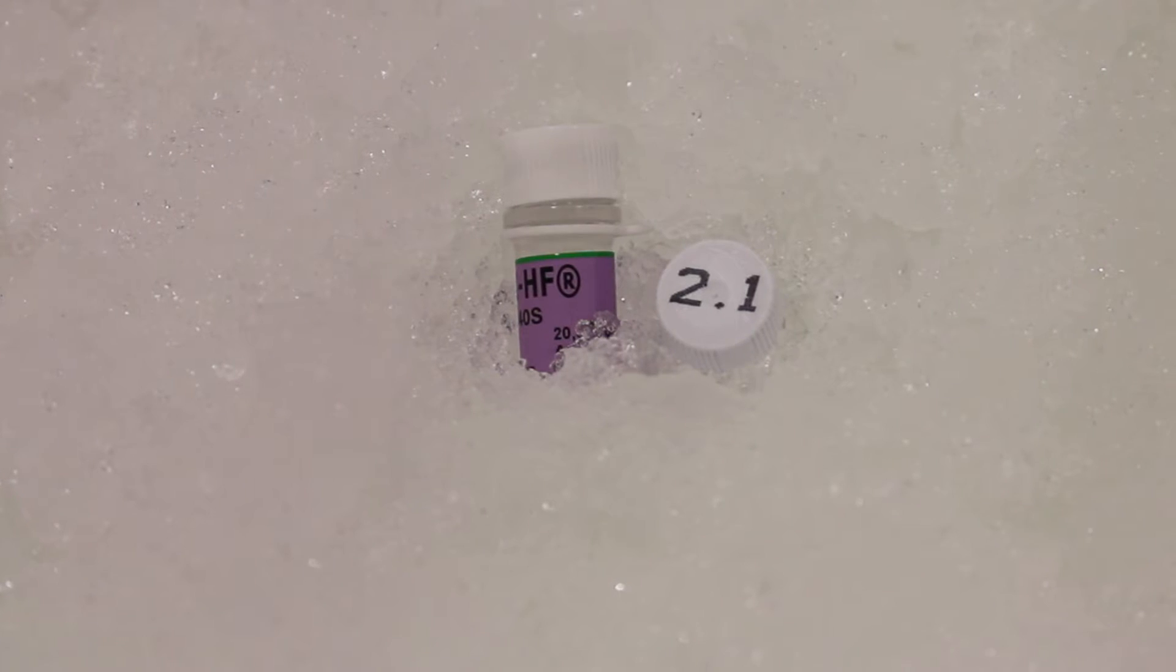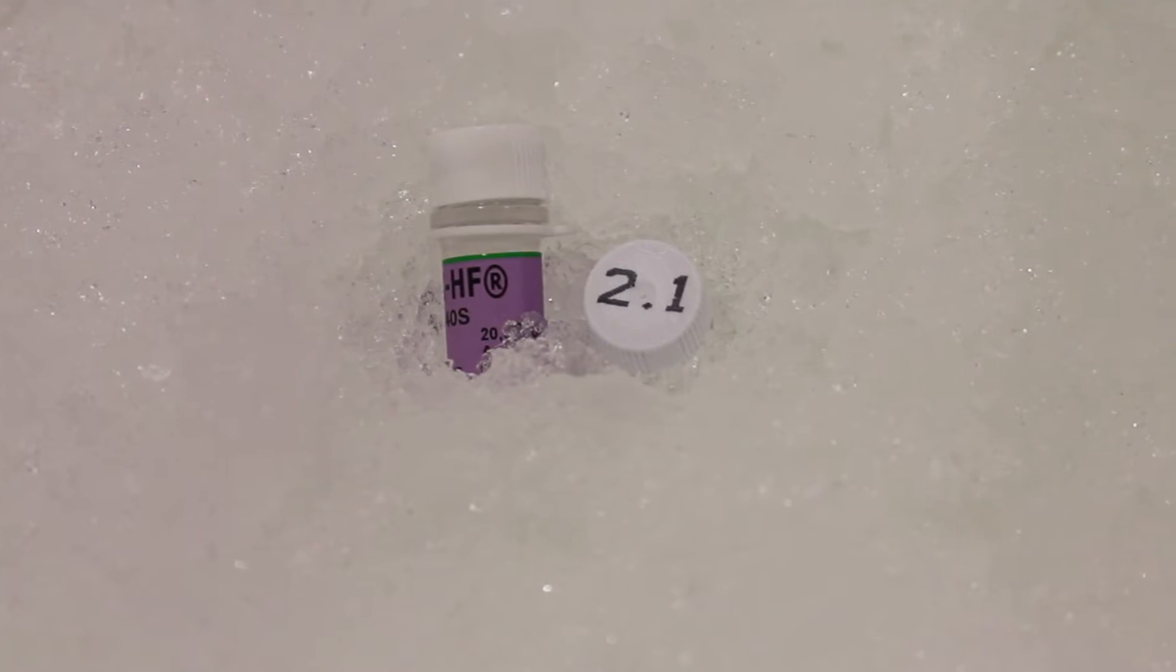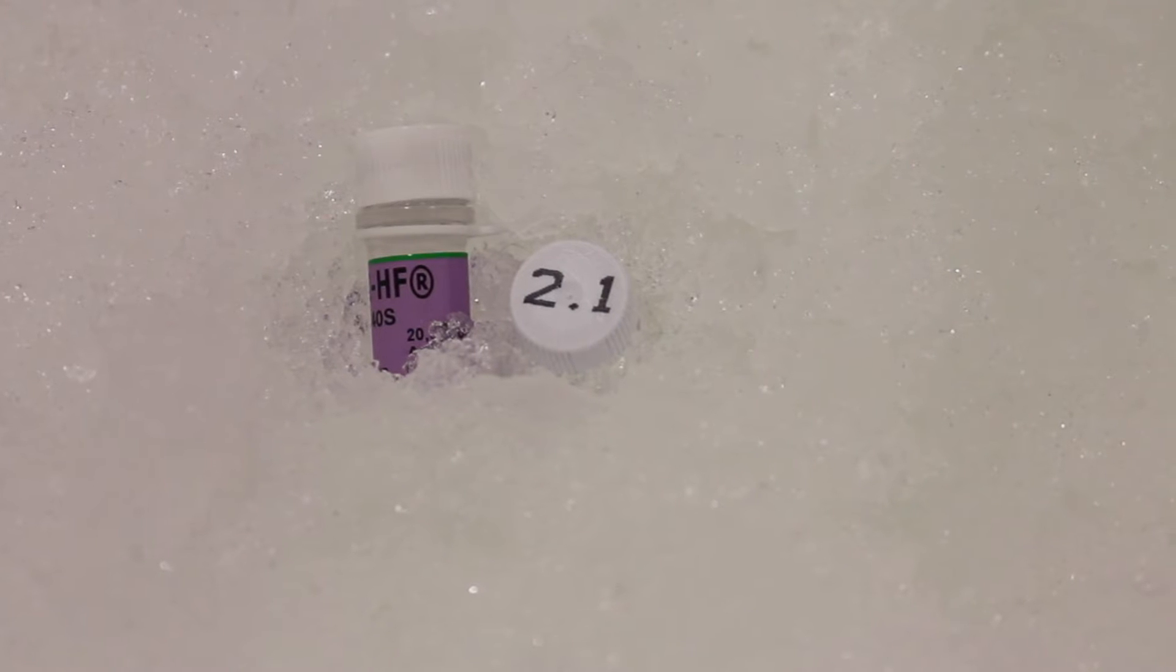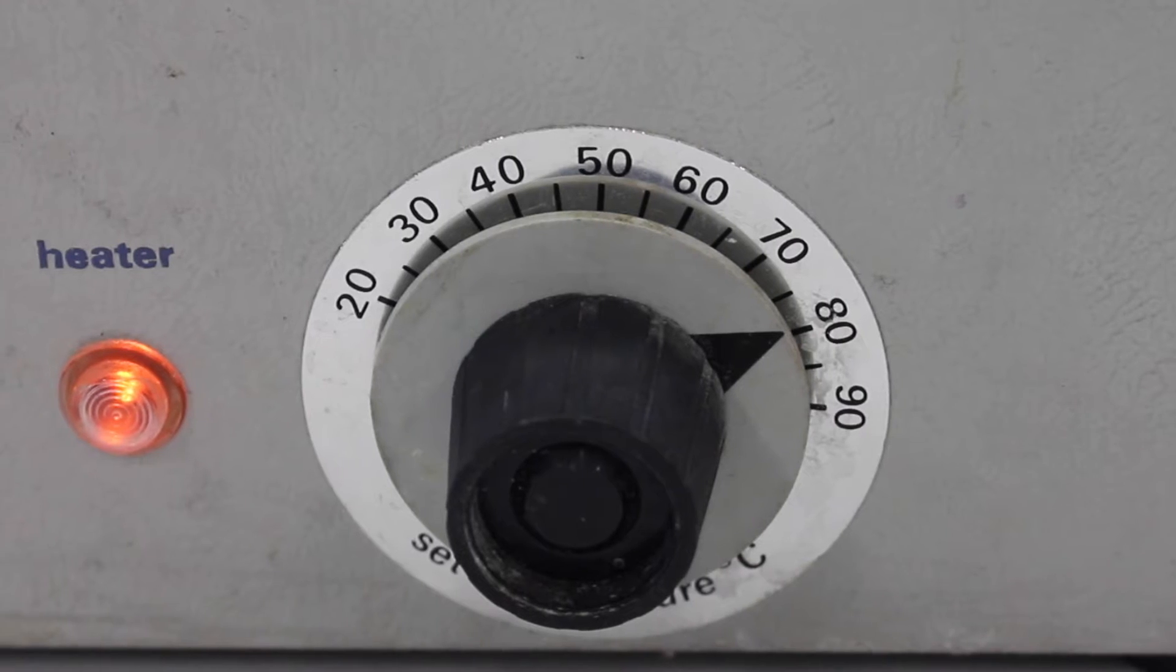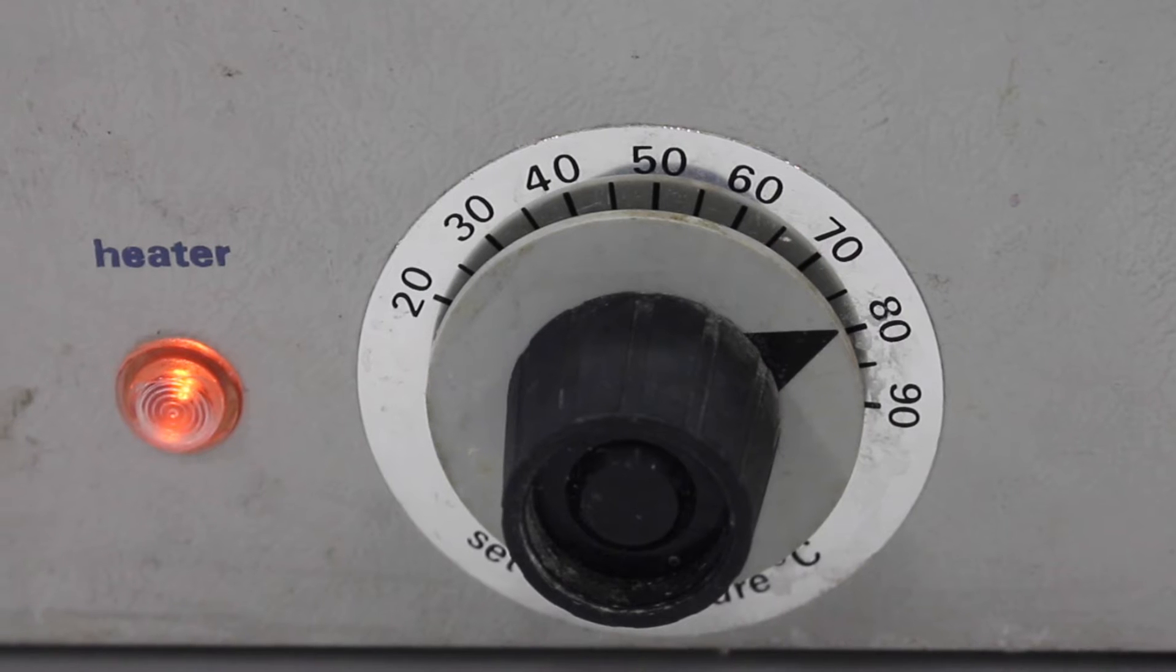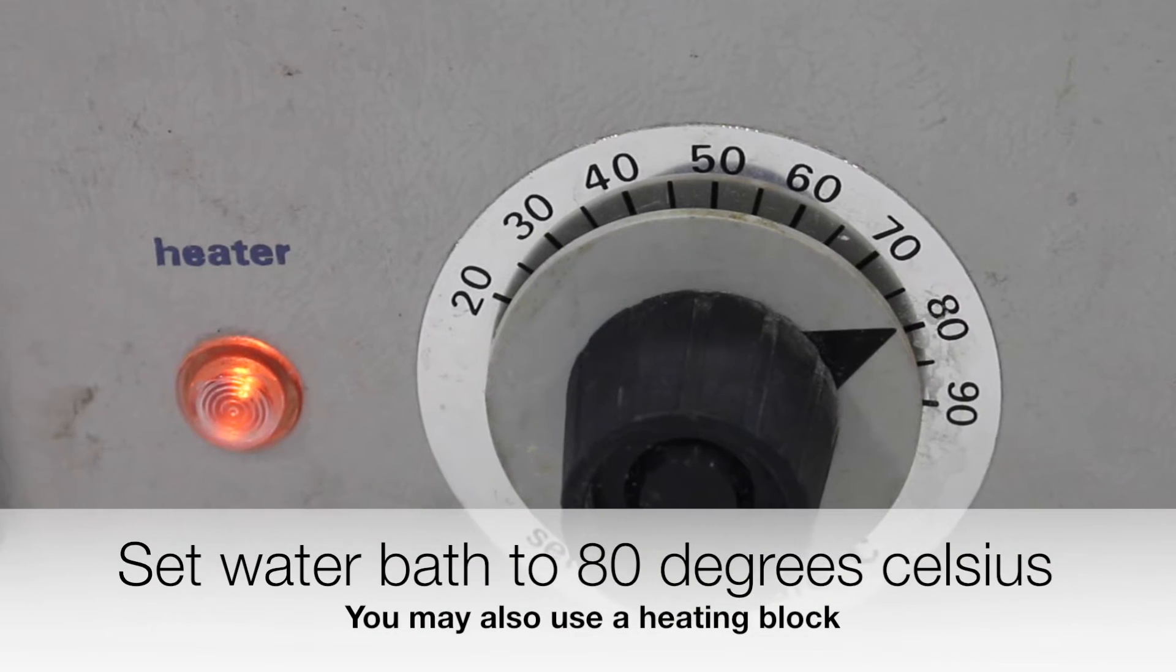In this video, NEB buffer 2.1 and high fidelity restriction enzymes were used. Before commencing the BioBrick 3A assembly, make sure that the water bath is set at 80 degrees Celsius.